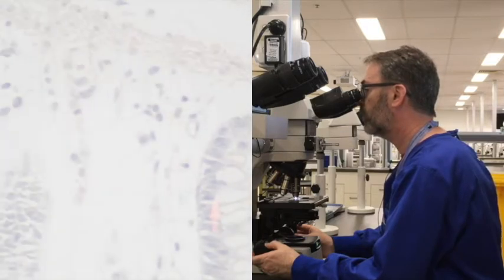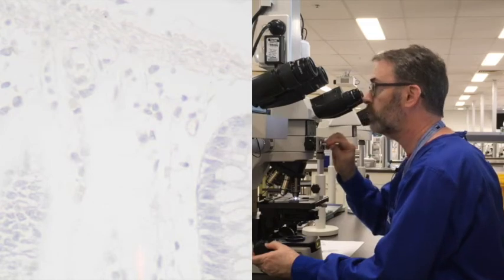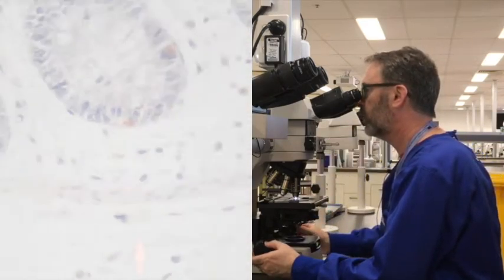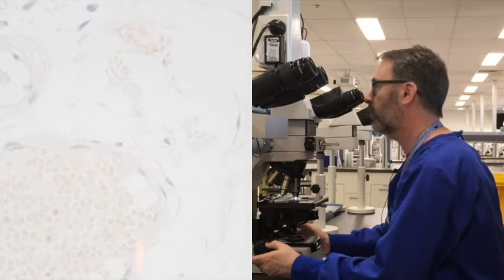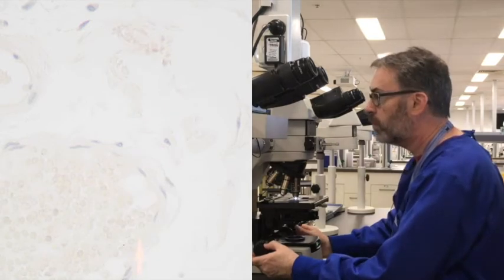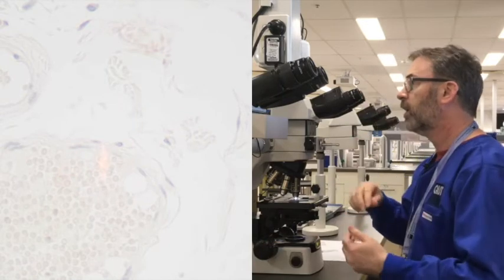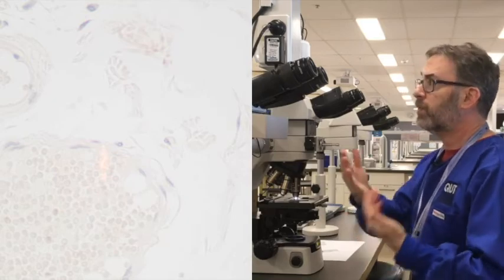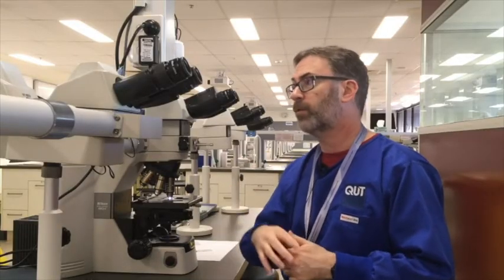and so it's quite difficult actually in places, especially within the connective tissue area there. Many of those nuclei are actually lacking much staining. If we go out into the connective tissue area here, it's incredibly muted. Some of these fibroblasts and vascular endothelial cells have hardly any staining left in there at all. So this is just to demonstrate that you can, by accident, over-differentiate.